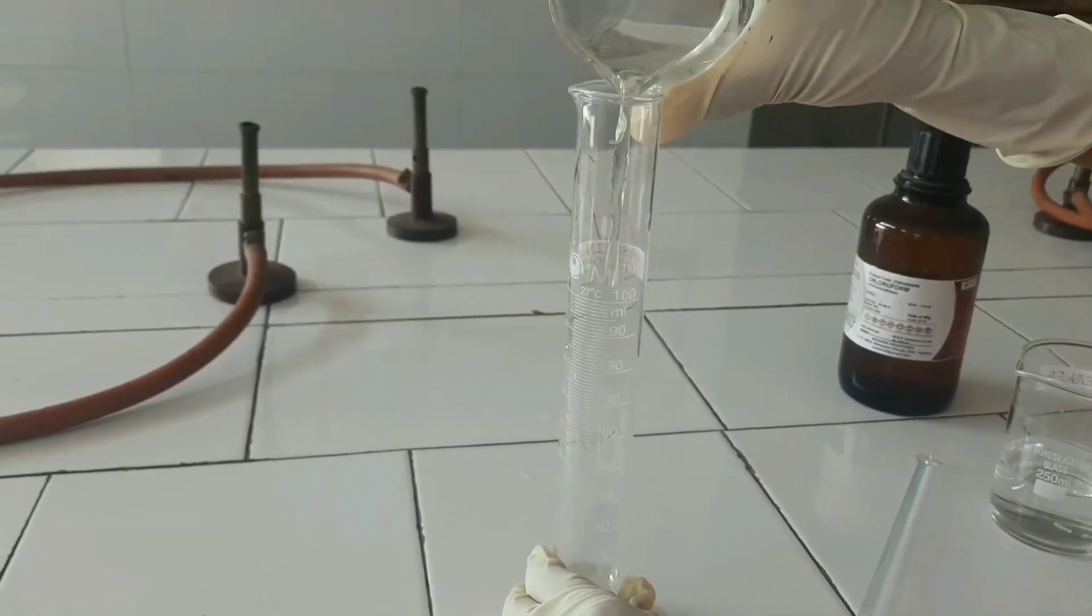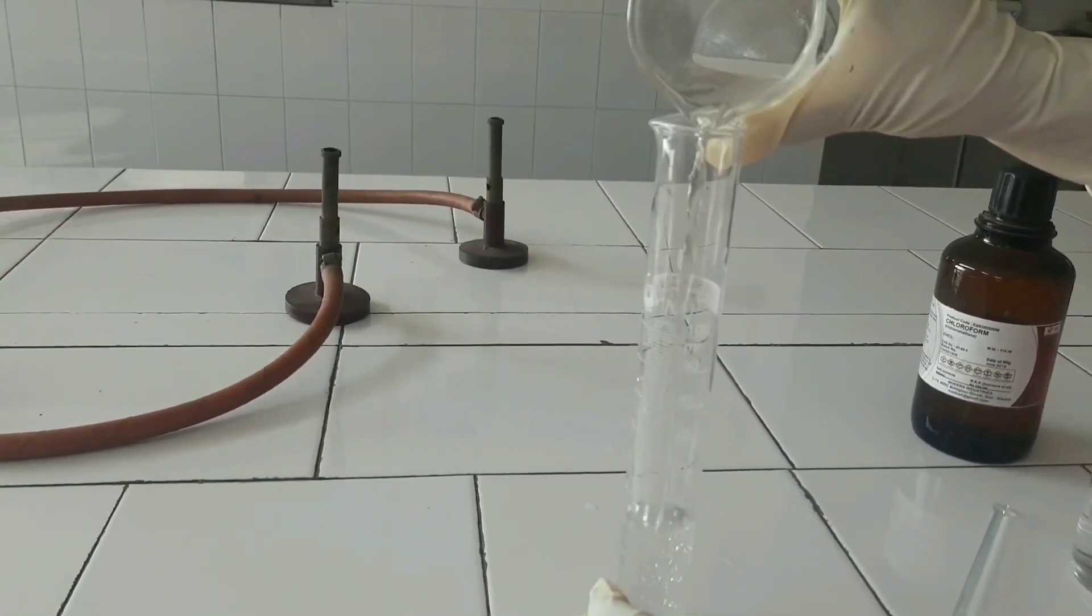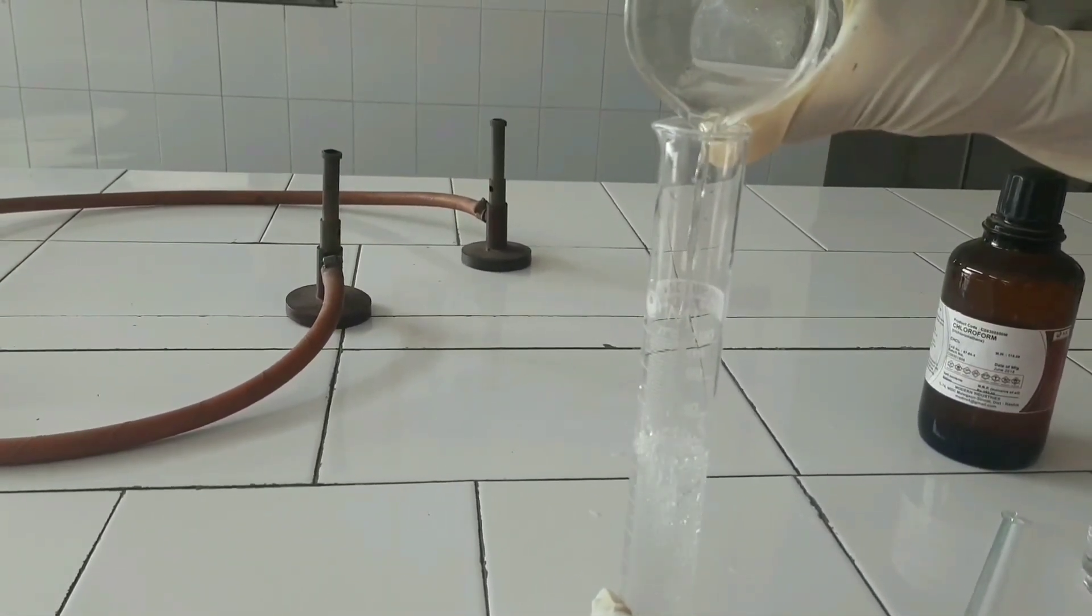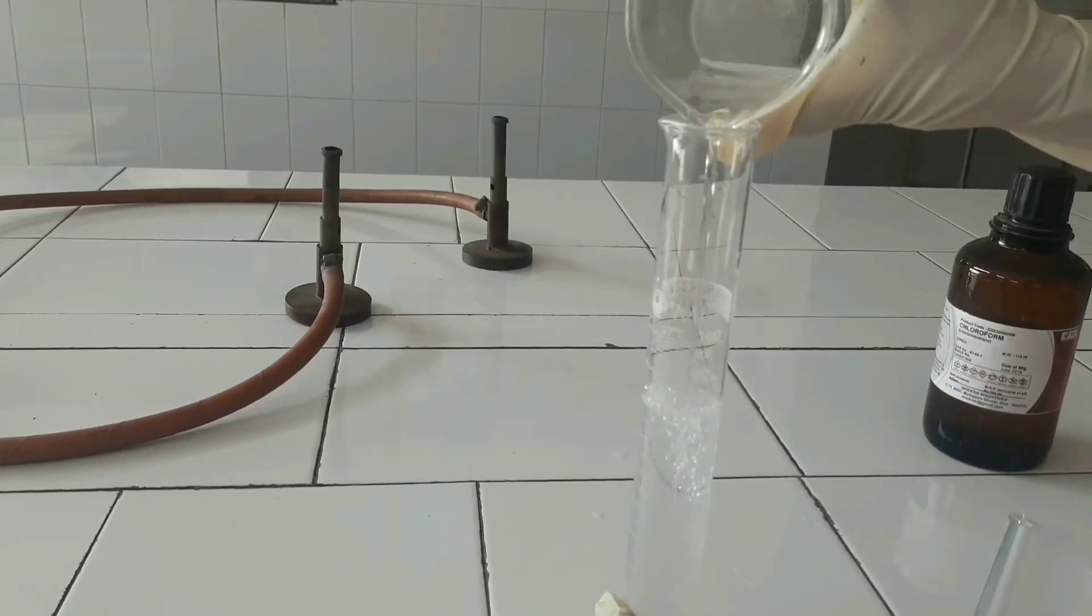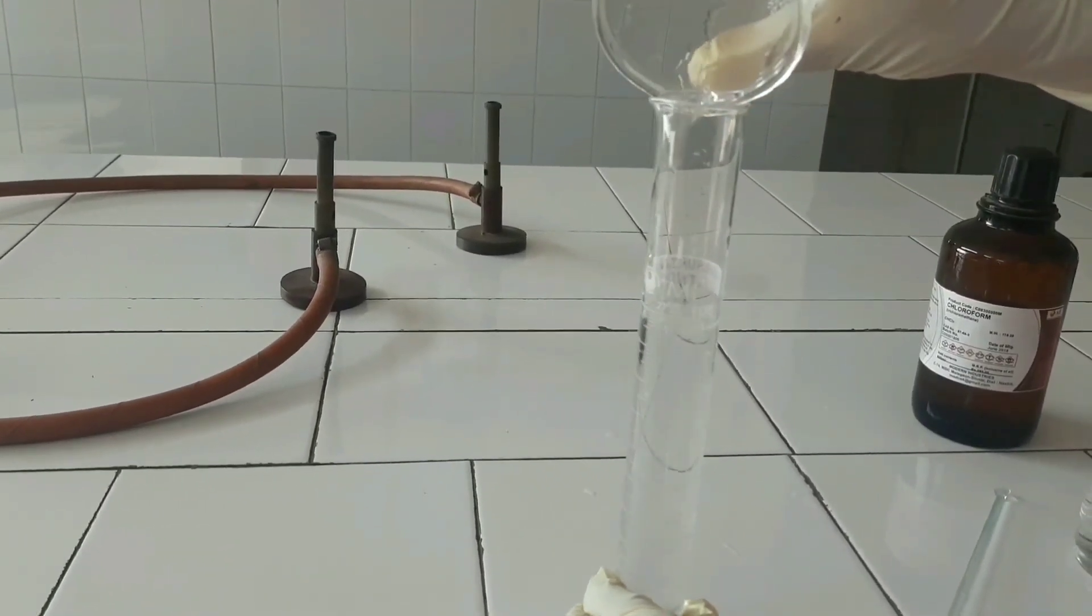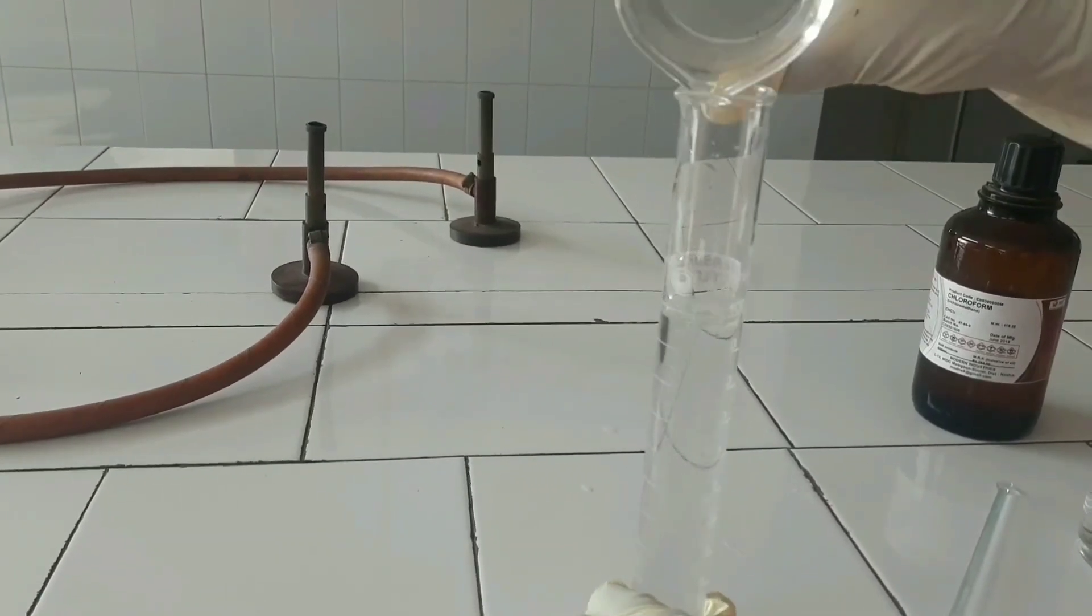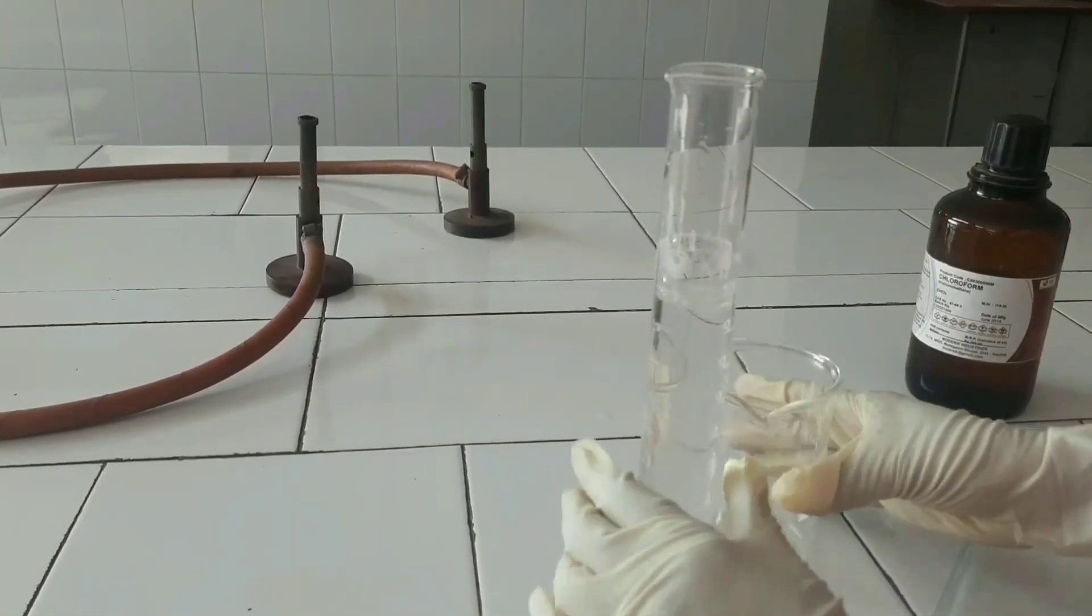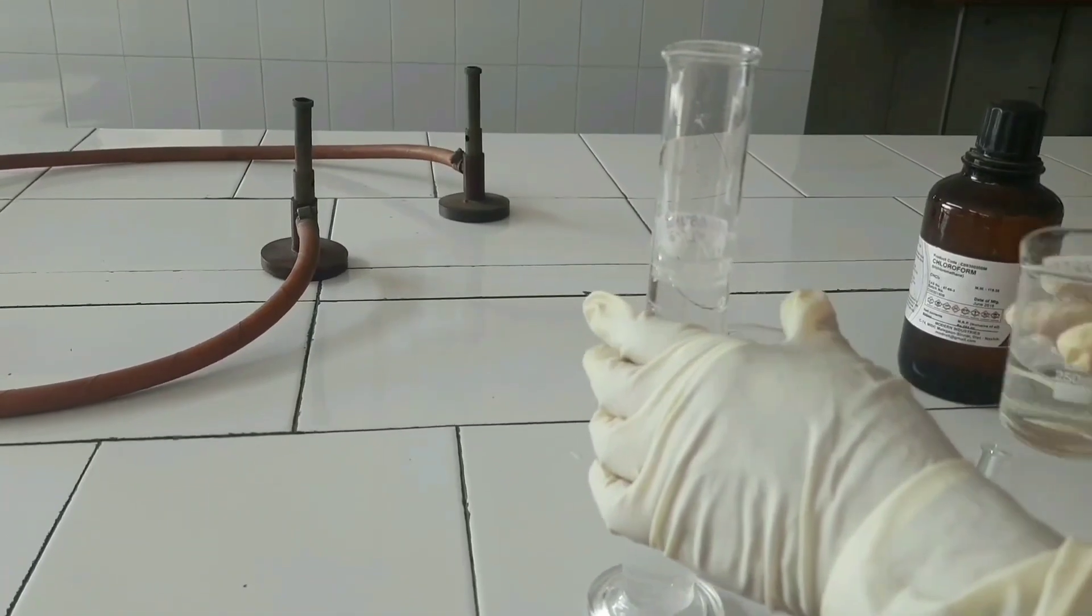Transfer it into a measuring cylinder and make up the volume to 100 ml. Then transfer it into a final airtight container.